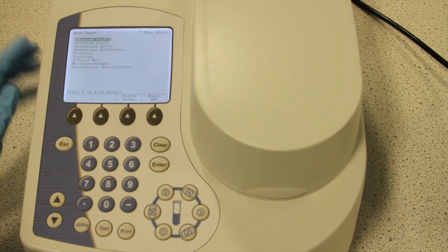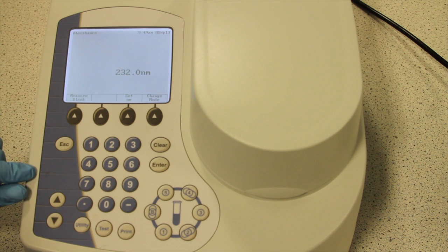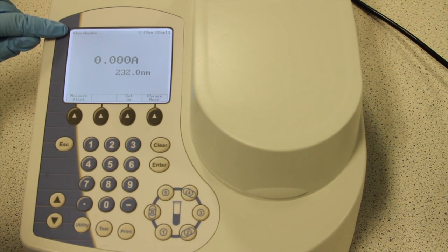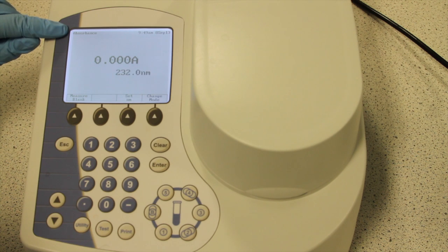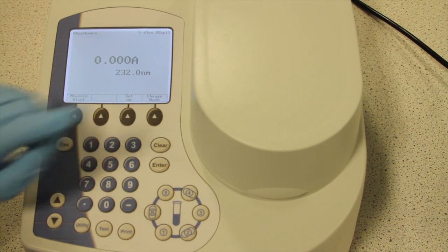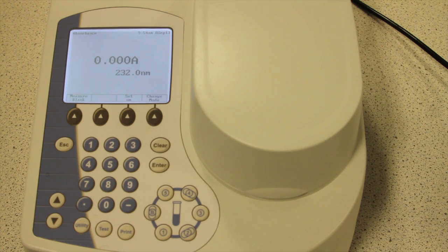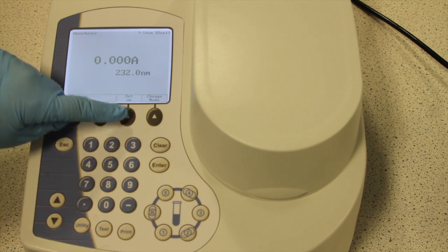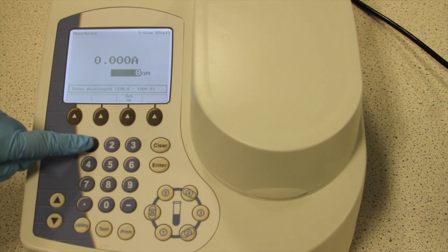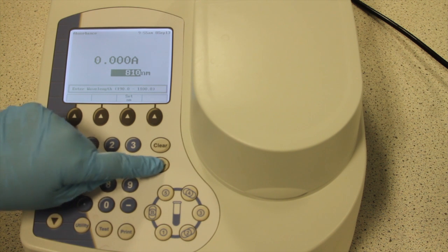If a menu is displayed, press escape until the measurement screen is displayed. Ensure that the mode is set to absorbance. If not, press change mode and you should then see absorbance displayed. To set the wavelength, press set nanometres and enter the value 810, then press enter.